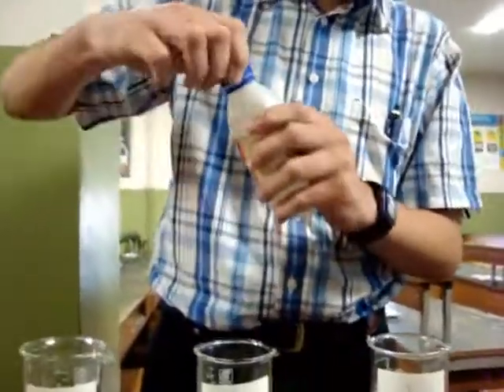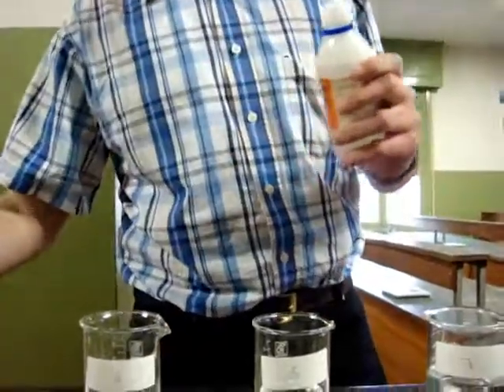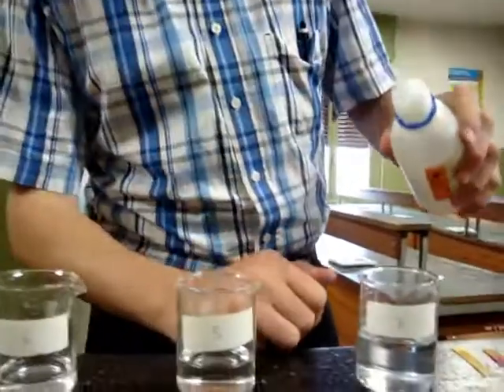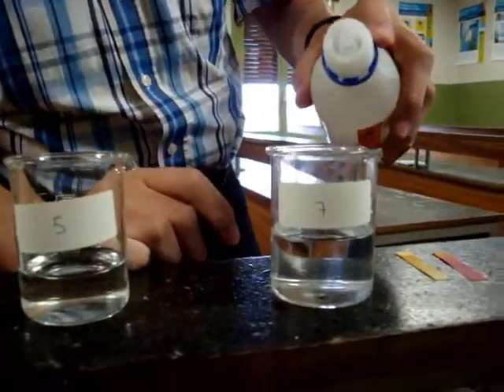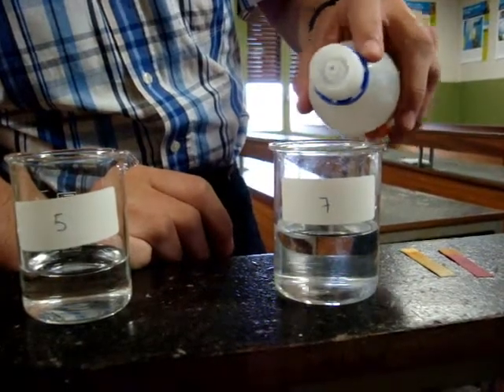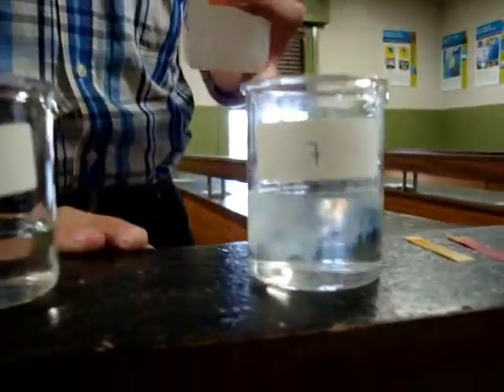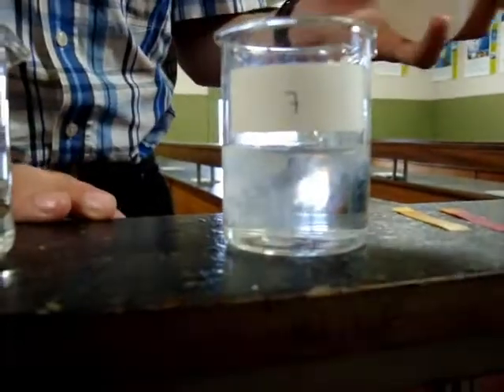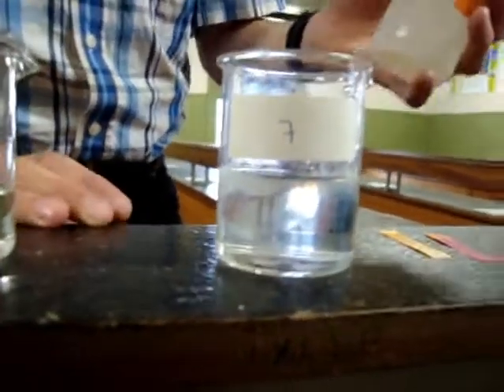Now we are going to fill the glasses with just a few drops of phenolphthalein. With the acid, it becomes white, a light pale color. It is nothing impressive.